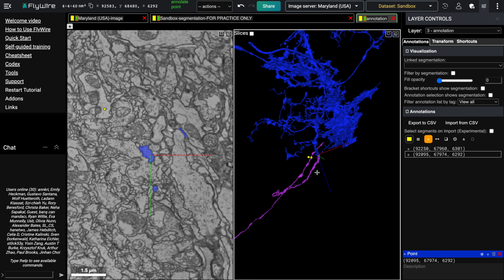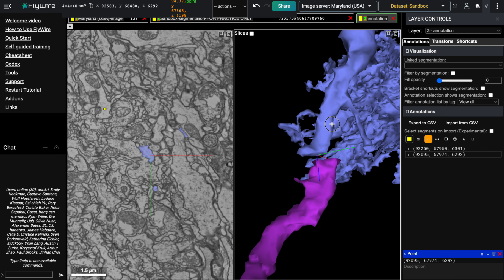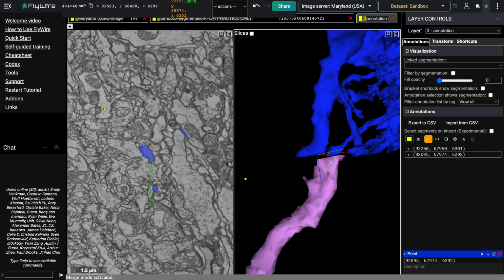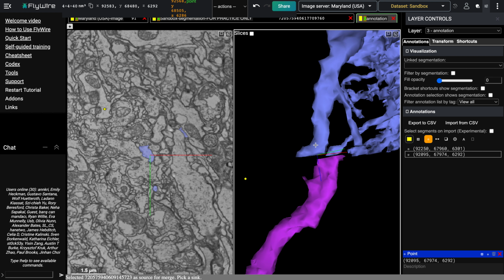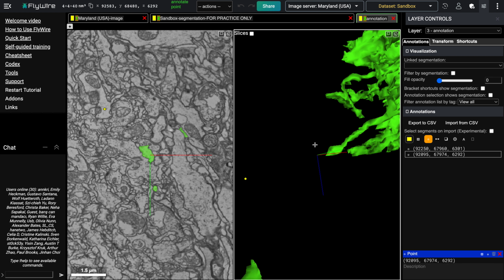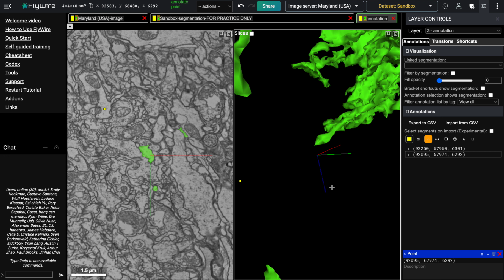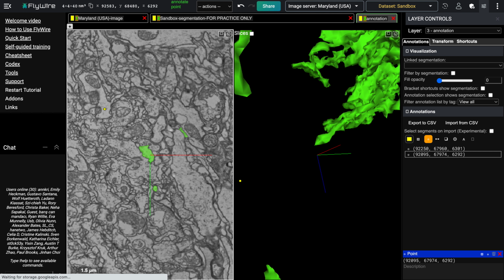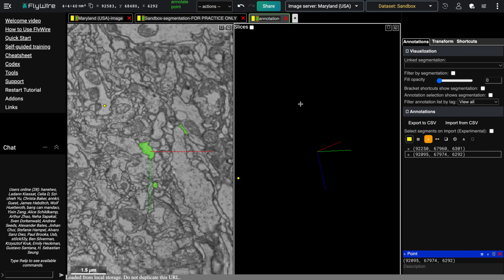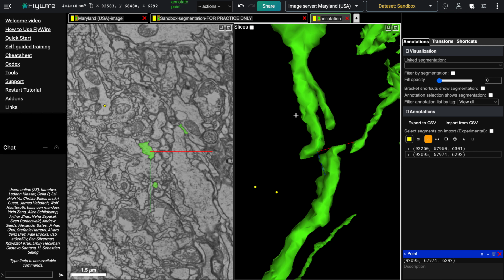All right, so after that, we're going to merge these two together. Just press M for merge, and we're going to select one and then select the other, and then they should merge together. And after the merge, we're going to need to refresh. And we can see that they're merged together in the correct place.